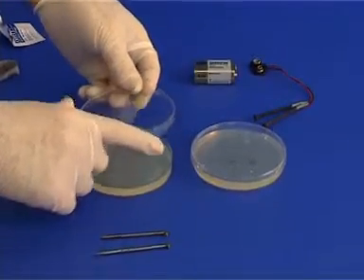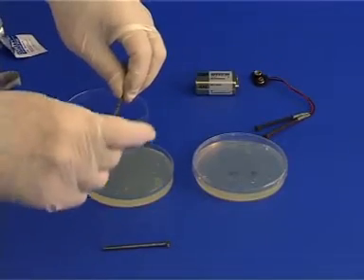Uncover the petri dish. Next press the two separate nails into the gel.